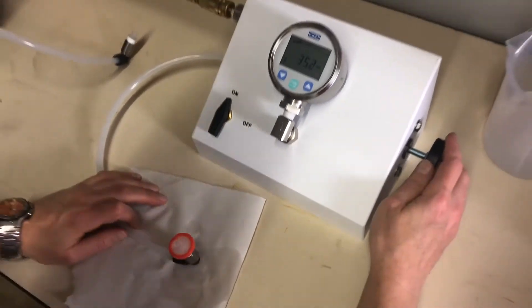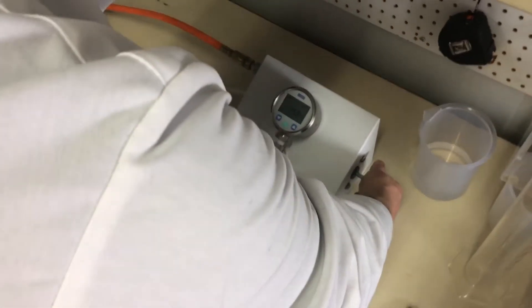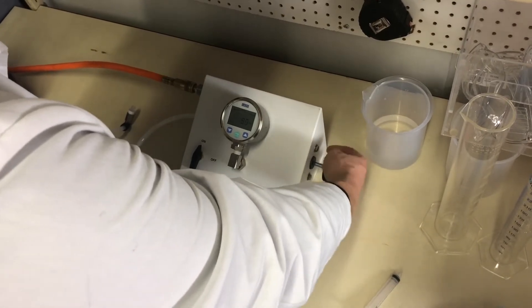And then once you record the pressure, I should have said that before I was putting it down, but you record the pressure, then you can relieve the pressure by turning counterclockwise rapidly until it reads zero.